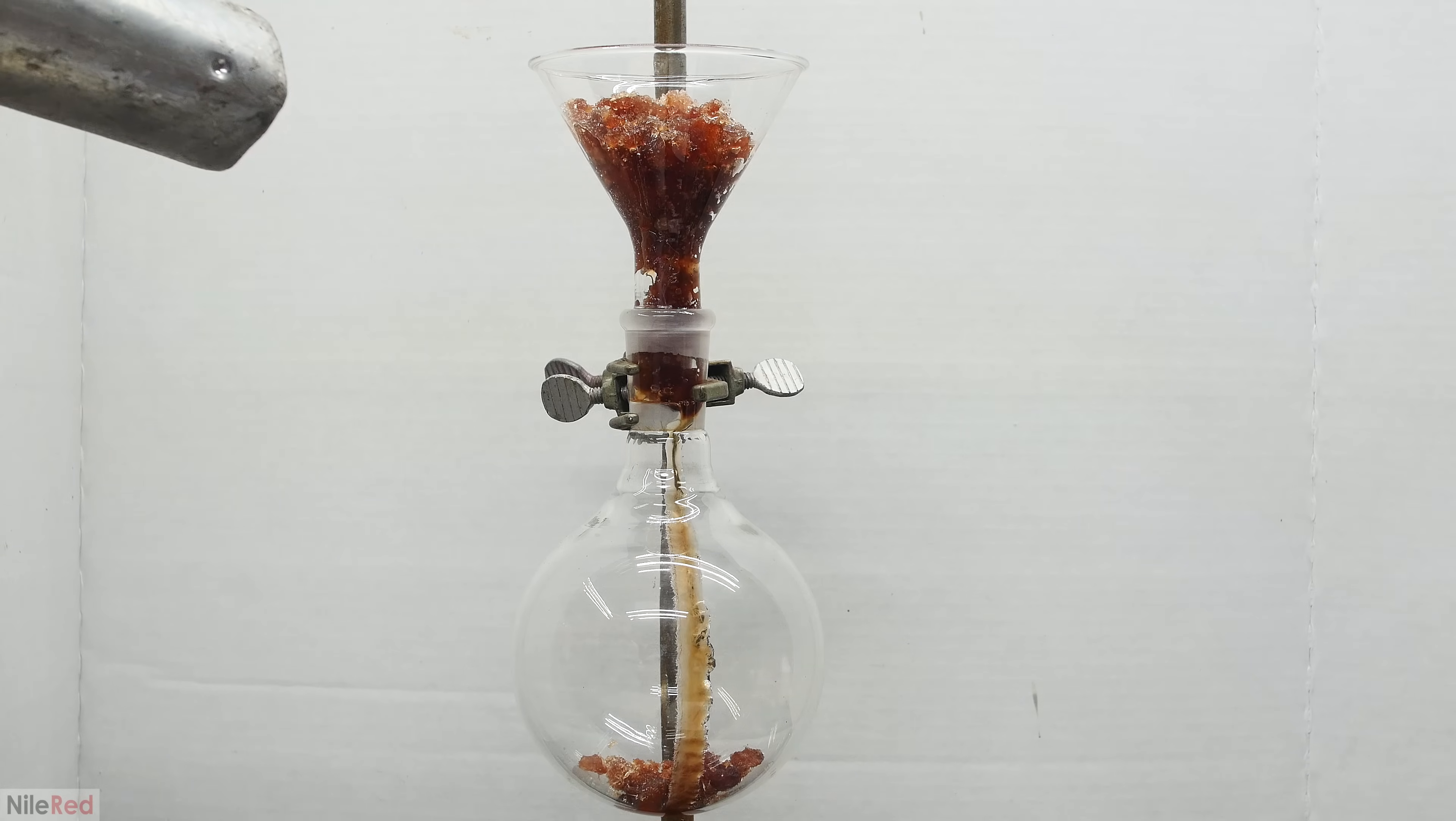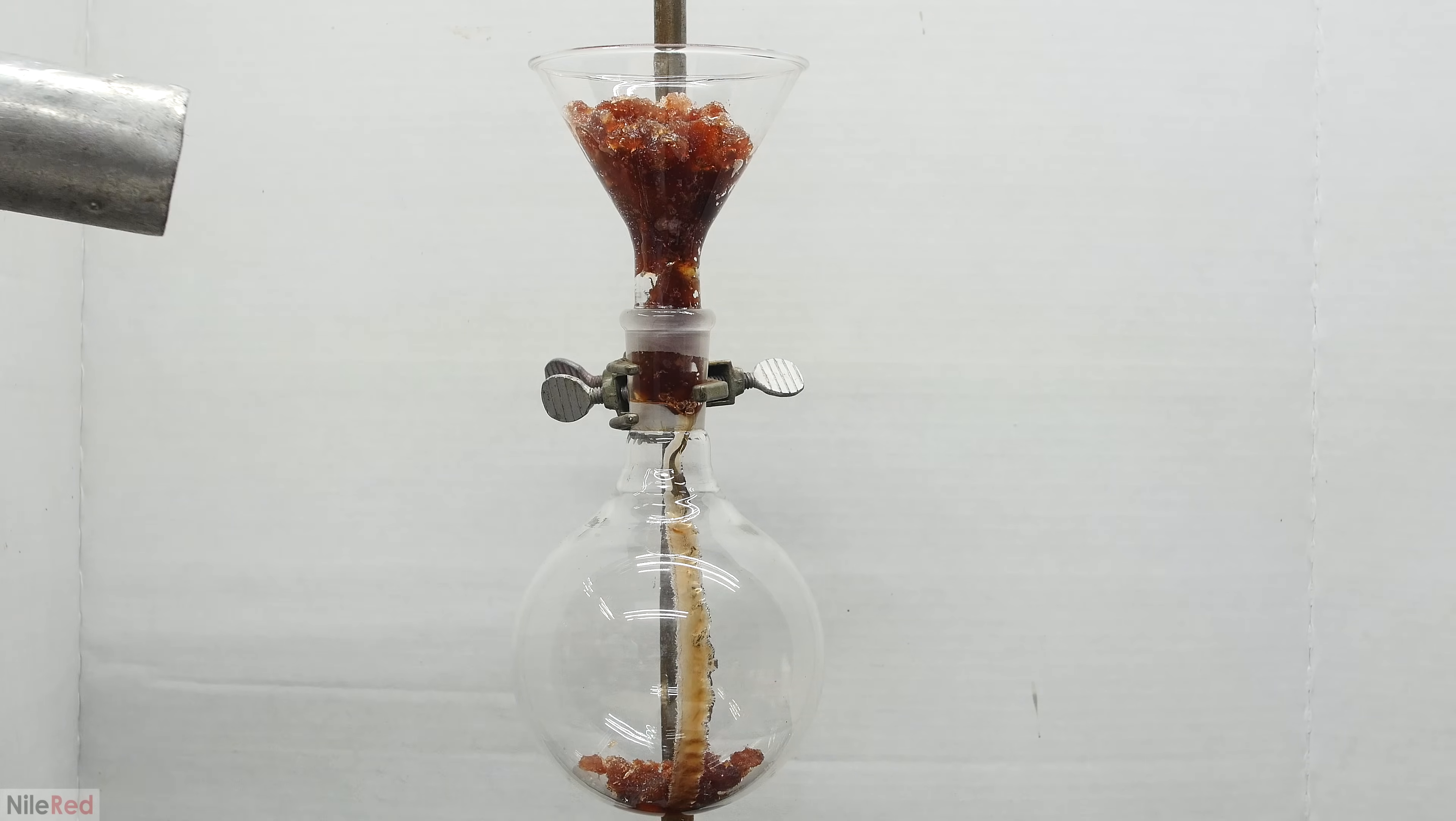In air without a catalyst, the polymerization is really slow, so it's only a problem with old samples.